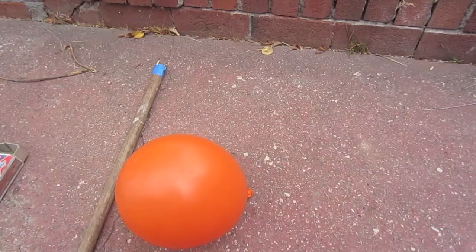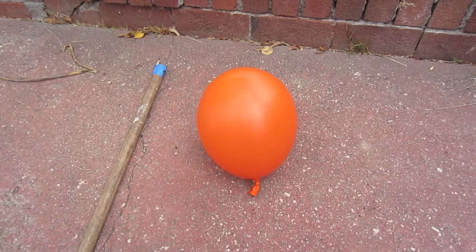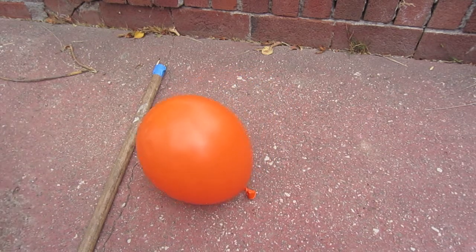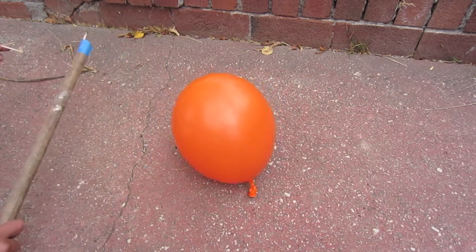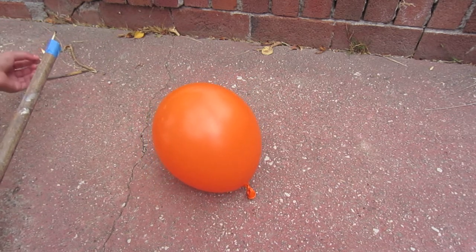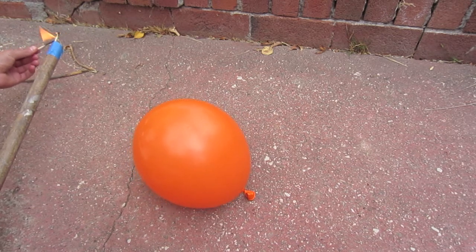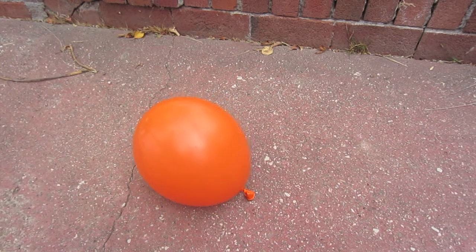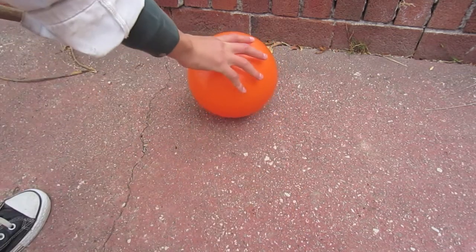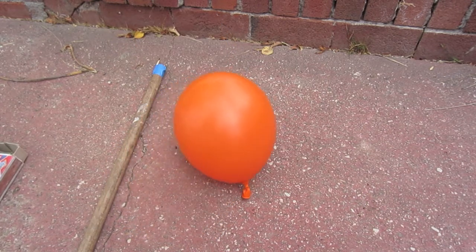In this example, although I felt a lot of heat when the balloon exploded, and the sound was a lot louder than that of a partially inflated balloon simply popping, the reaction, I assume, just happened too fast to be caught on camera, and you never see a really good cloud of flame like you do in the previous one. I thought I'd show it to you anyway, since the sound is pretty impressive, but not nearly as much as real life.